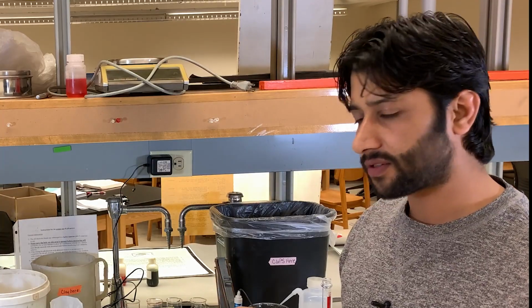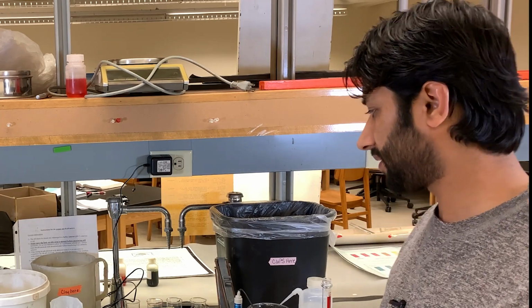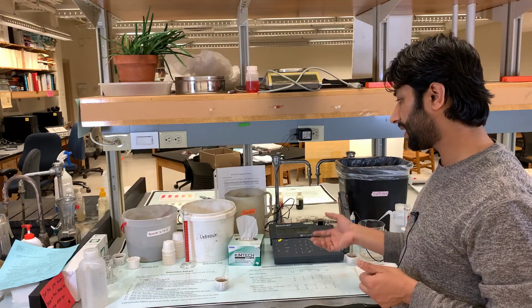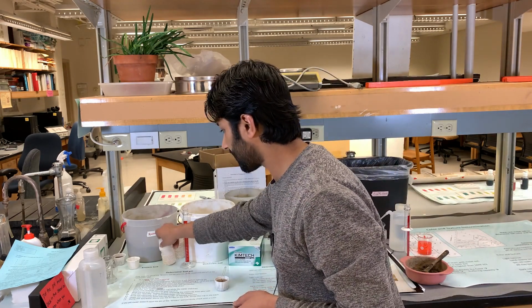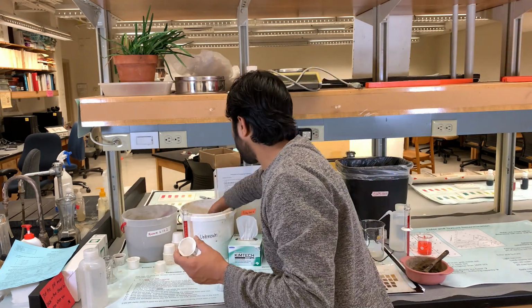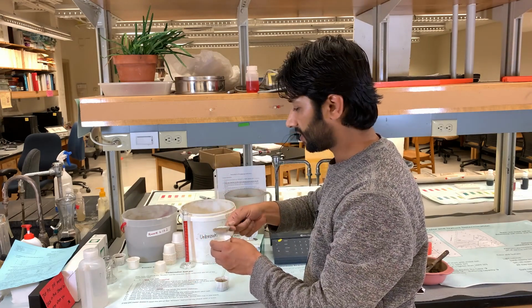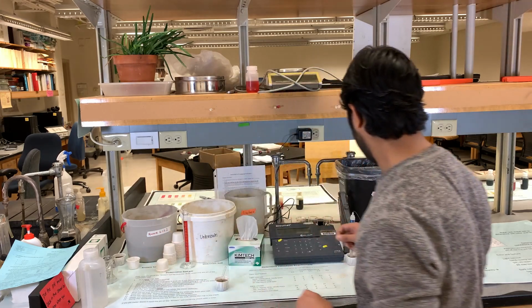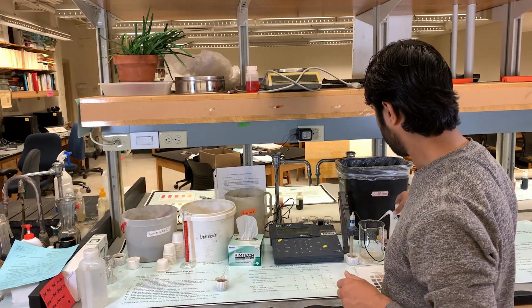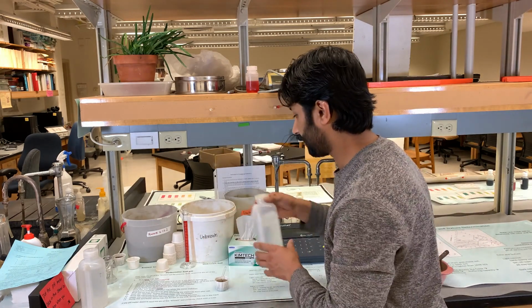In this station, we will also determine the pH, but this time with more accurate methods. So what we need to do is prepare our sample first. We need to follow a few steps. Take a cup, and then add a spoon of soil into this cup, and then add 20 milliliters of DI water. So the deionized water, you need to get 20 milliliters and then add it to the cup.